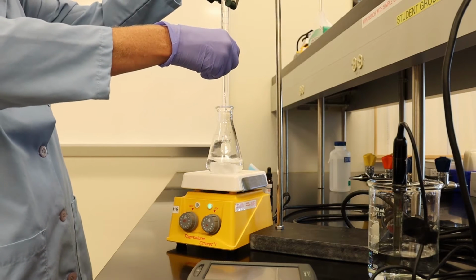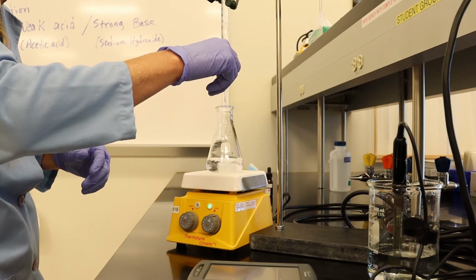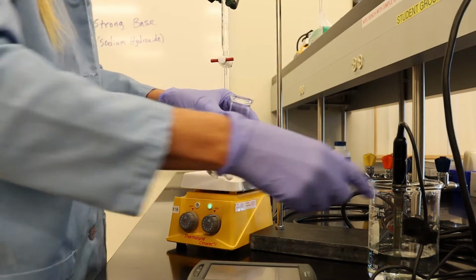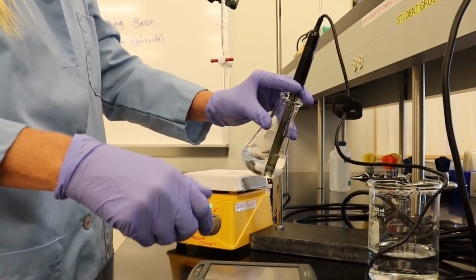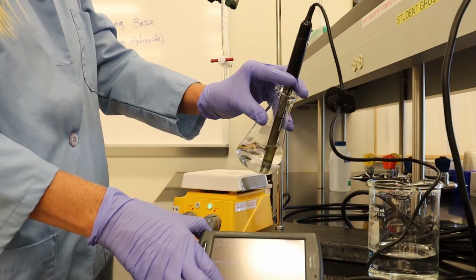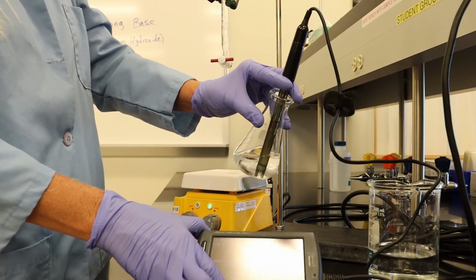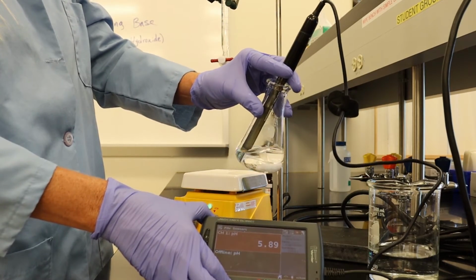So let's do 2 more. Looks like we're at about 5, fluctuating again. Let's go with 5.89.